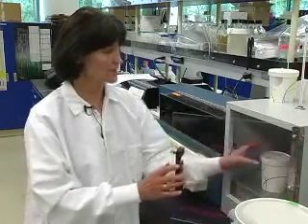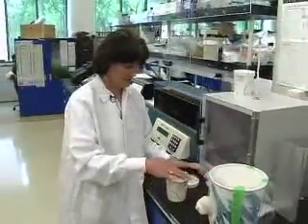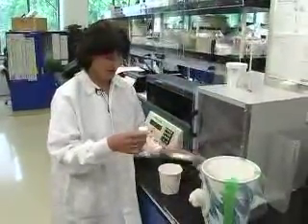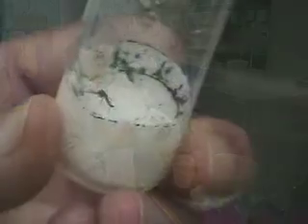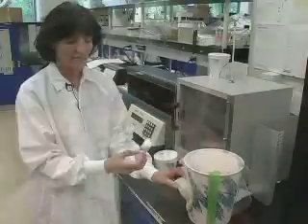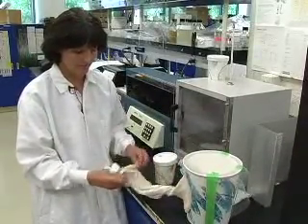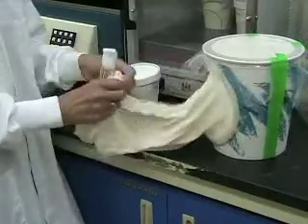One hour and 15 minutes has passed and embryos should be ready for microinjection. I am taking them from the chamber. You can see the embryos are black dots on the paper. Right now I am transferring females to the cage and just letting them fly in.